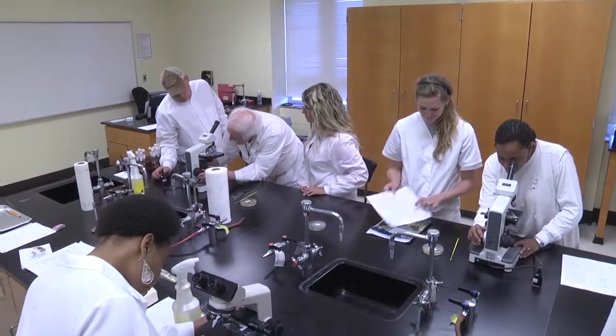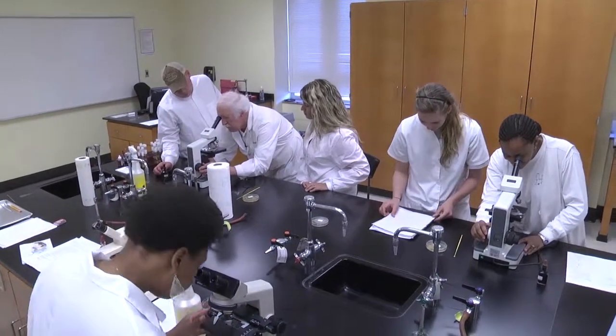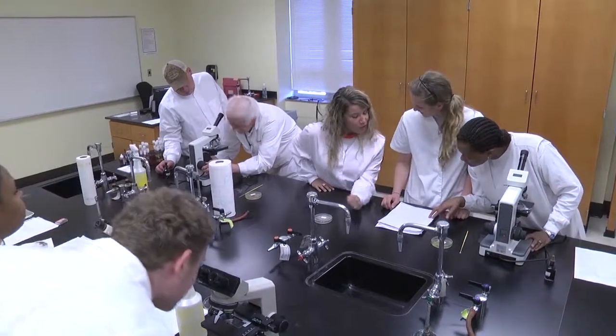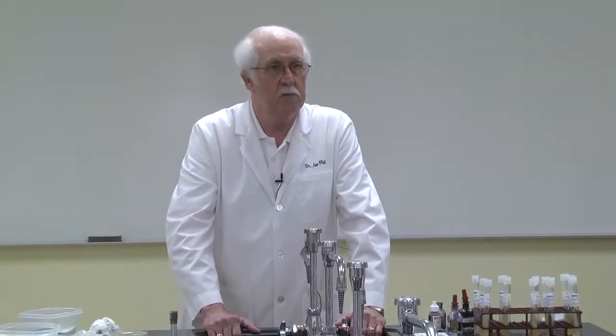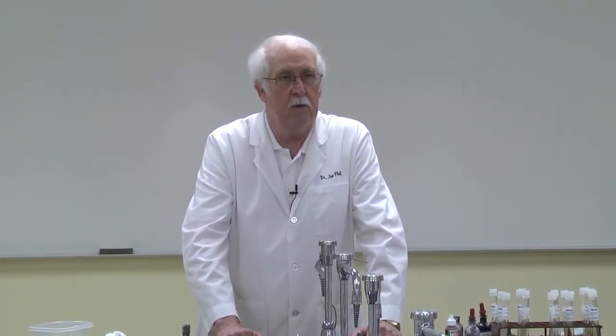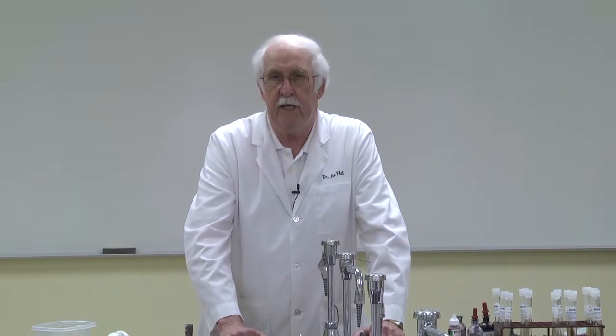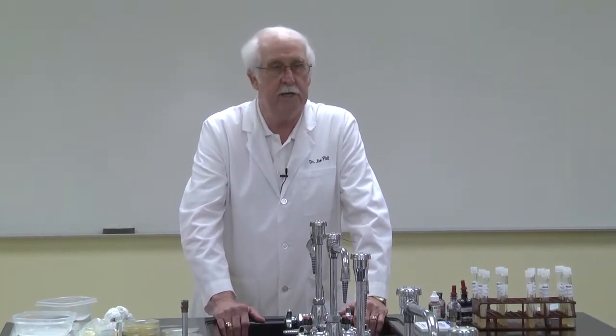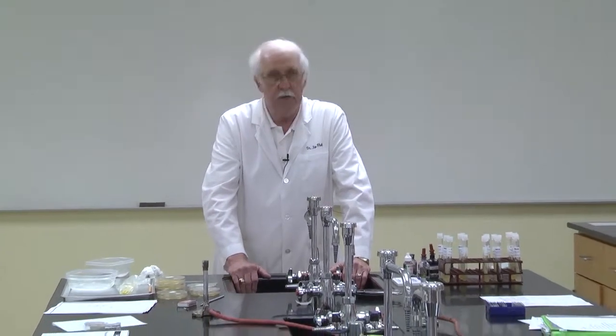You have the exercise in front of you that we'll be doing. The next thing you would do is scrub the tabletops as I've done up here. Then you would get the microscopes. These are compound microscopes. They're top of the line, and so you can go up to 1,000 diameters with these. Get well organized before you start. Make sure you have all the materials that you need, and then do the negative stain.